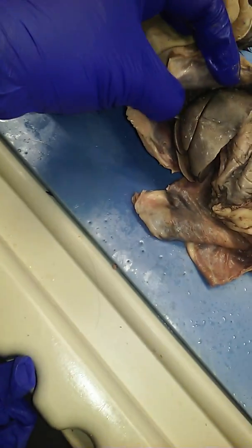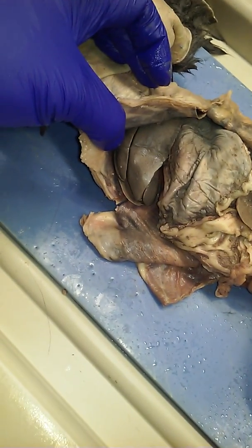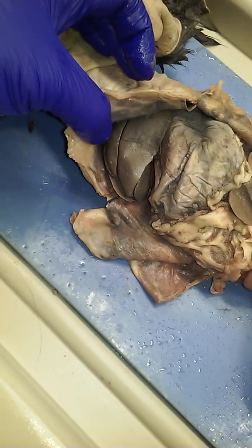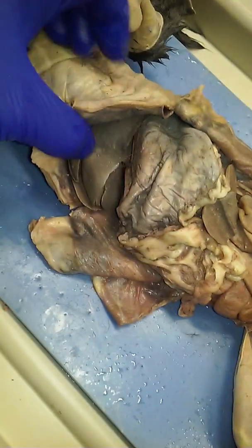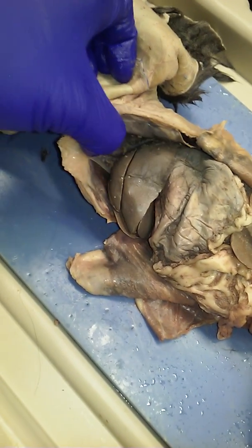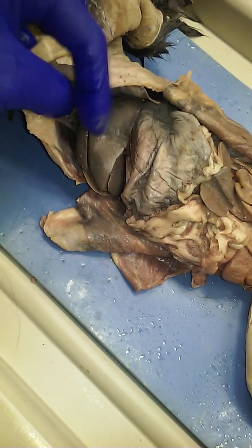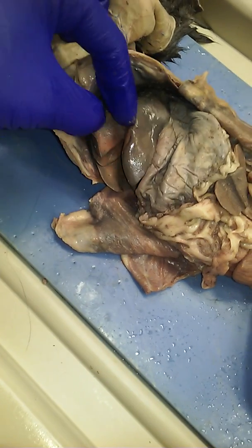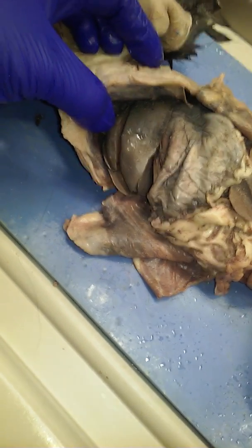Okay? Now, here's the reality. The cat's liver is actually in 7 chunks, 7 lobes, but 3 of them are down underneath the other organs where you can't see them. So we're going to ignore those for the moment. I don't need you to study those. But because we could have cancer in any one of these lobes and we want to be specific, we should be able to name which lobes are which.